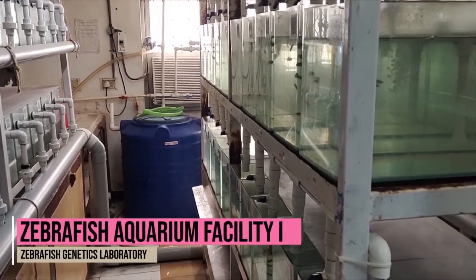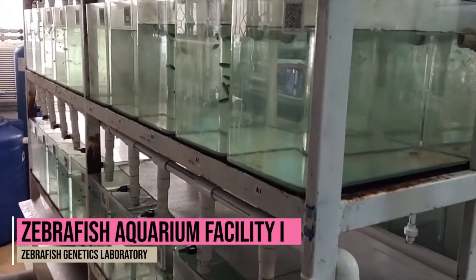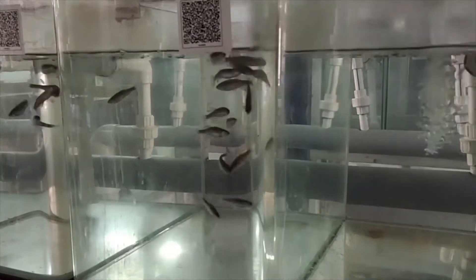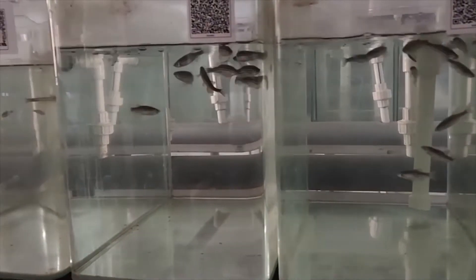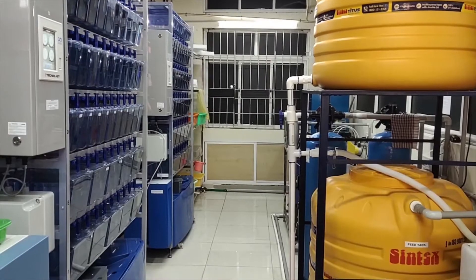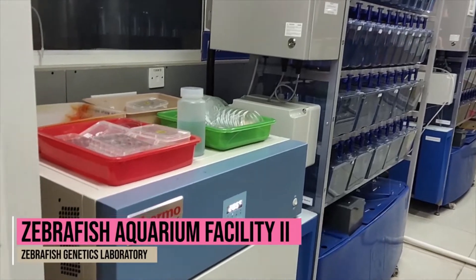Another major research interest in the laboratory is developmental neurobiology, wherein we are trying to generate zebrafish models for microcephaly and Parkinson's disease. Our laboratory is funded by the Department of Biotechnology, Government of India, the Department of Science and Technology, Government of India, and SRM Institute of Science and Technology. Welcome!